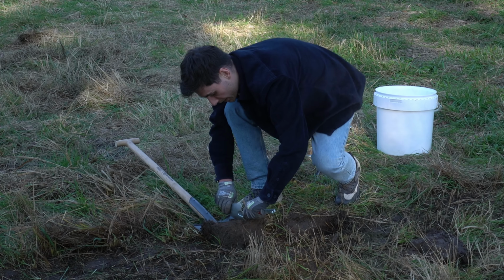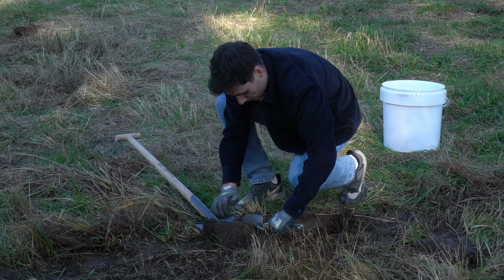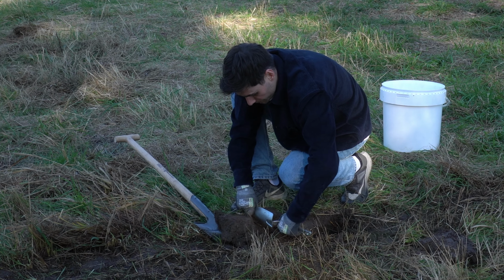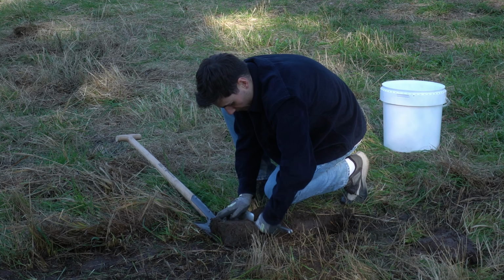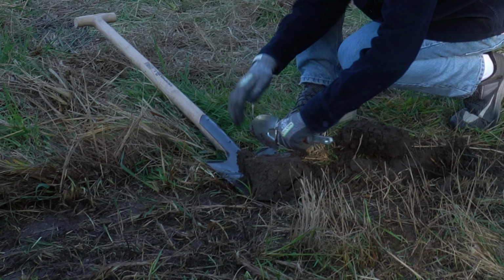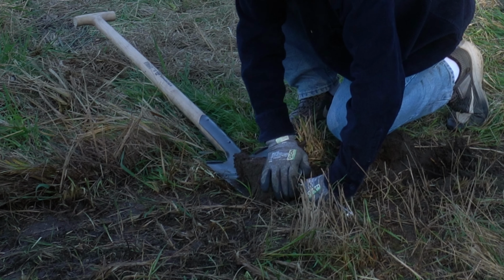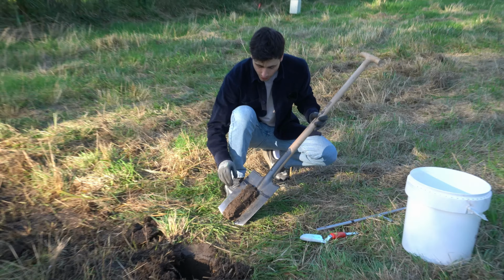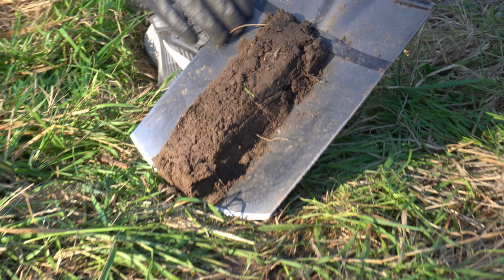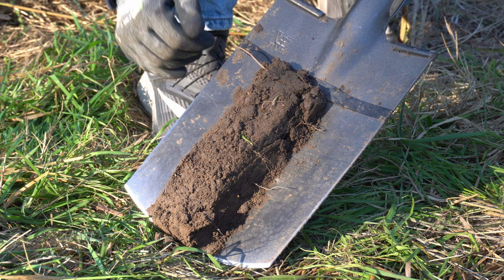So what we do first is from the sides, we remove about this much. So we keep only about 3 centimeters in the center. Now, this one and also this one. And as you can see, we now have a very nice and even cross-section along the depth of 20 centimeters after trimming off the sides at the spade.